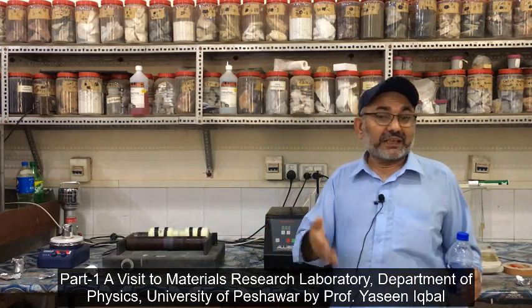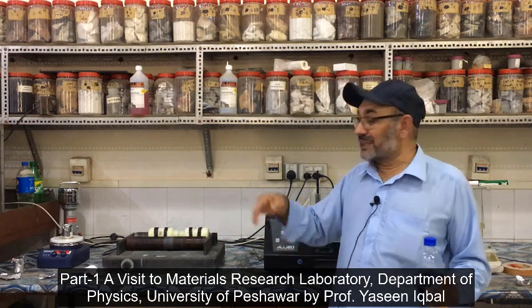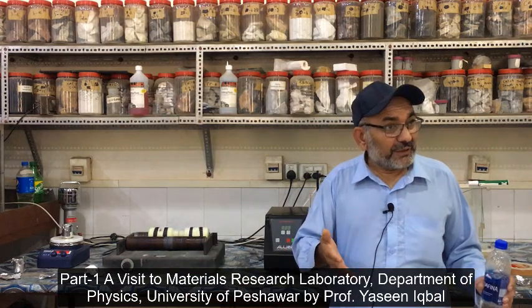You must know the material of the jar. For example, if it is a porcelain jar, porcelain is aluminum silicate — alkali aluminum silicate. If the material grinds inside it and touches the jar surface, there is a possibility of contamination from the body of the jar. So if you are making barium titanate and you find aluminum silicate peaks in the XRD, this means your milling jar contaminated your material. That is why people started to mill materials in disposable milling jars.